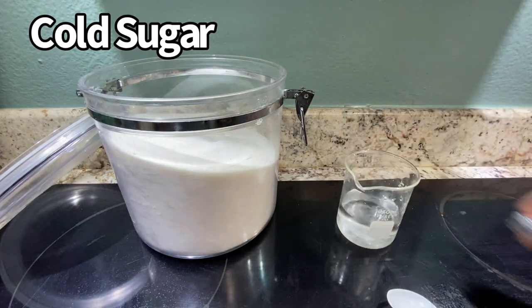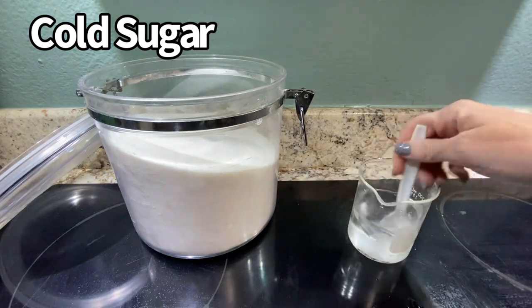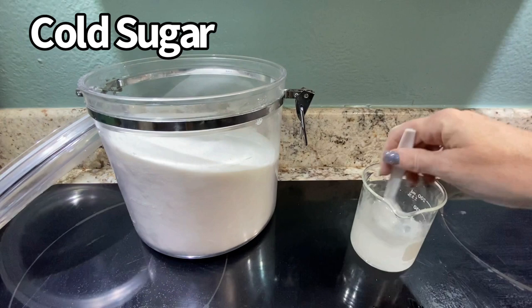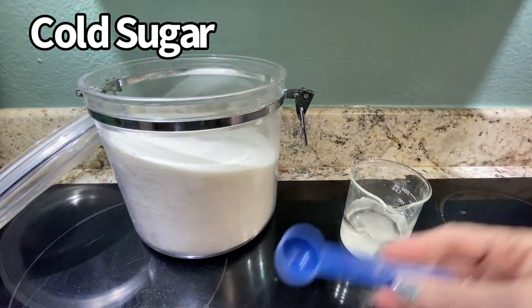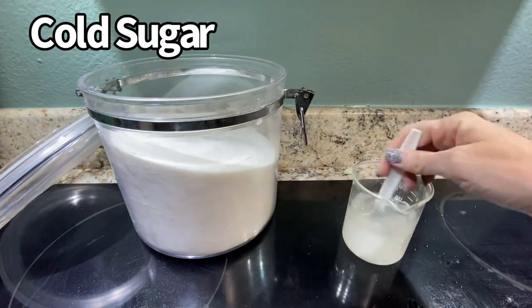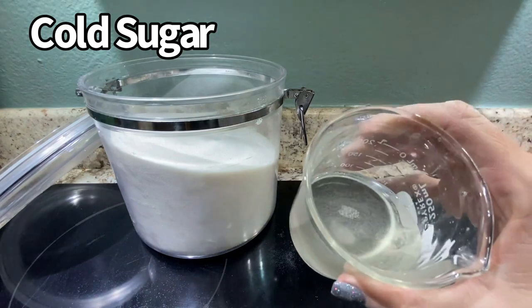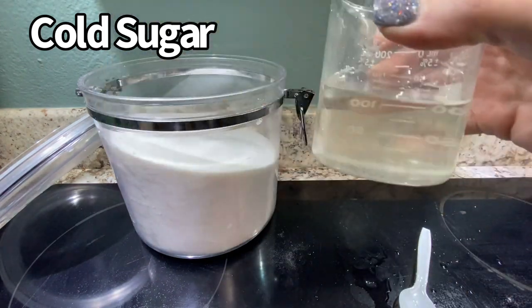There was five — dissolved easily. And 10, 15, 20, 25, 30, 35, 40, 45. It looks like it's going to be about 45 milliliters of sugar dissolved in that 100 milliliters of cold water.